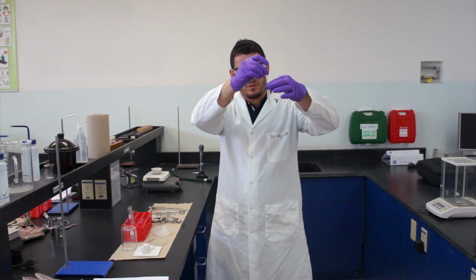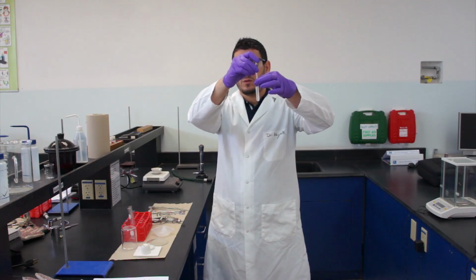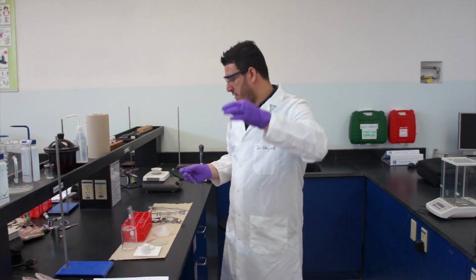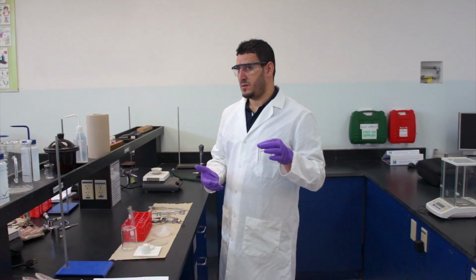Okay, so see already I added too much. This change, the dissolution of sodium chloride, is it physical or chemical? So you have to answer this question. After dissolving the sodium chloride, this is already one change that happened here. You have to answer the question.